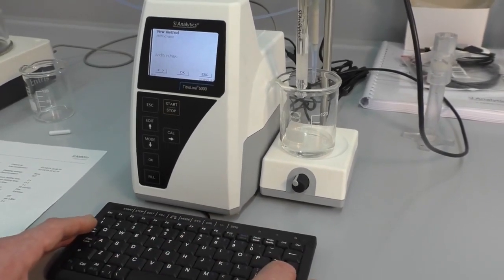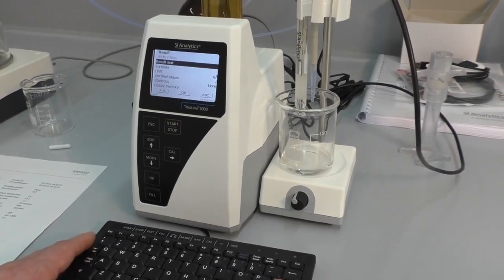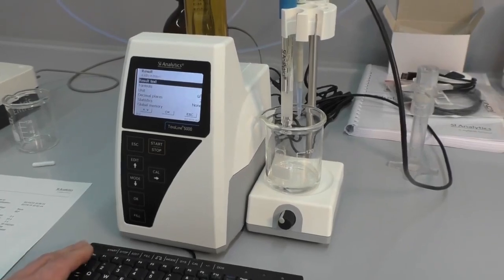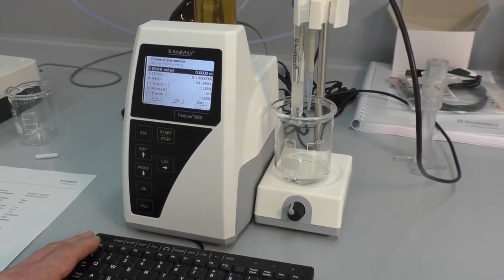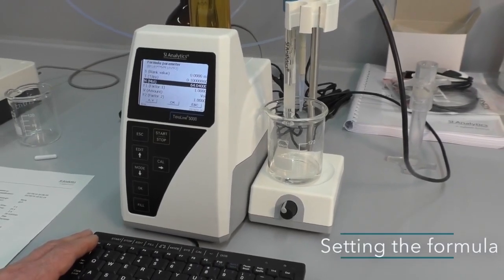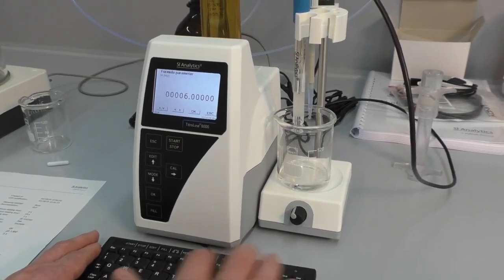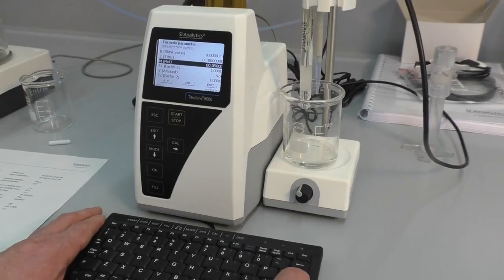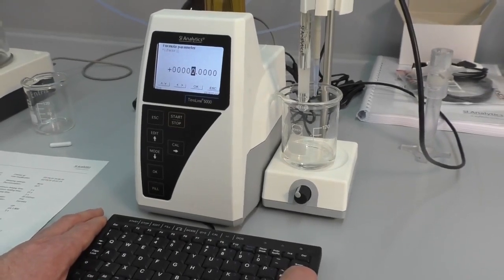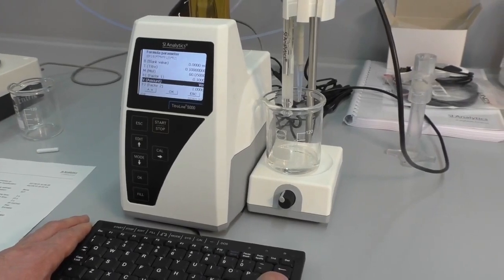Okay, fine. Next step is we have to change the result calculation, because the acidity is fine, but the formula has to be changed a little bit. Now we have the equivalent weight of citric acid here, and we will have to change it to the molecular weight of acetic acid. The factor has to be changed, because now we want to calculate in percentage, and percentage means gram per 100 gram.